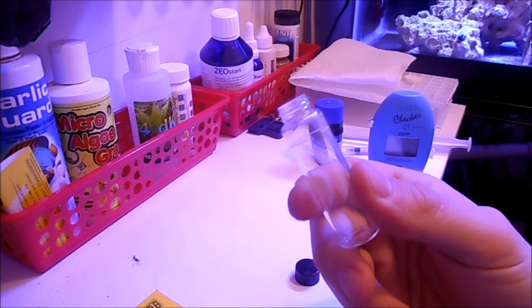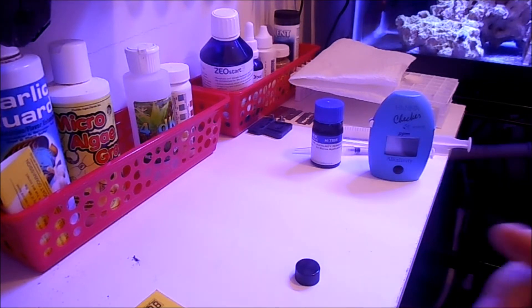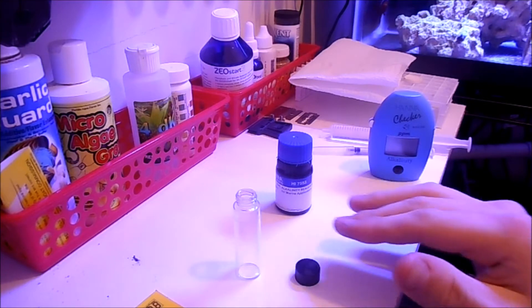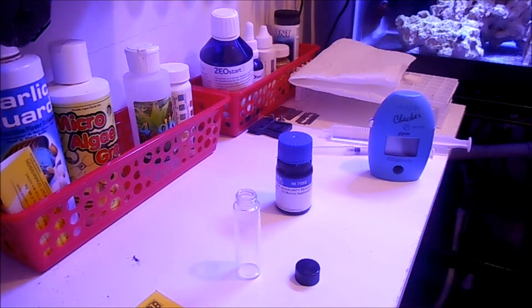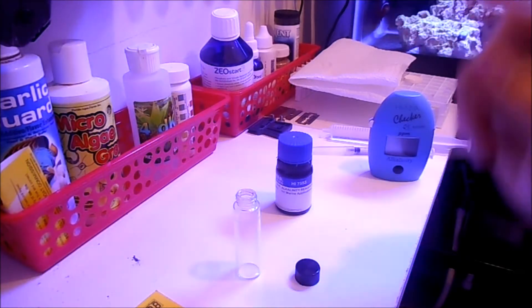The key to success is to make sure that it's clean - no fingerprints and no residue. One quick note: when you're done using this, it's going to be a greenish color.